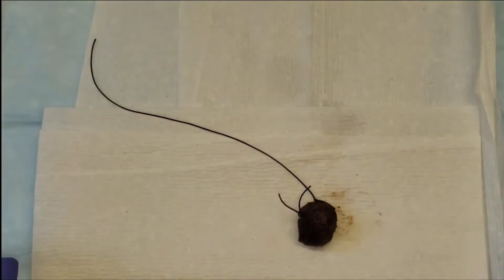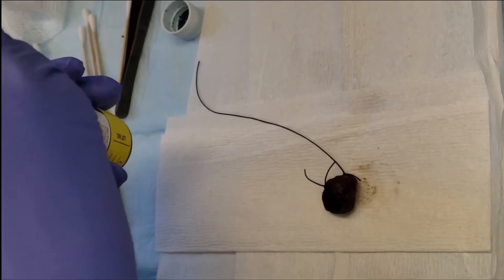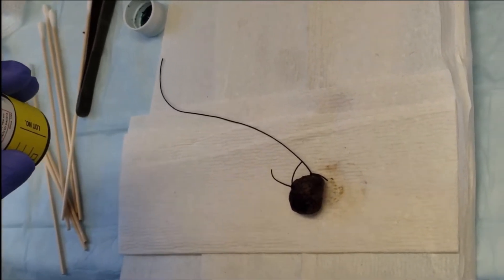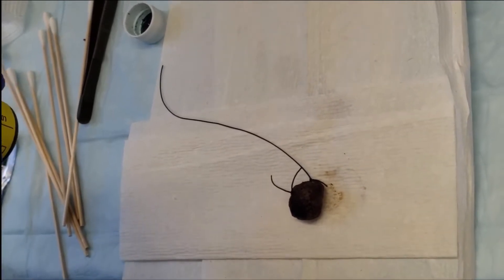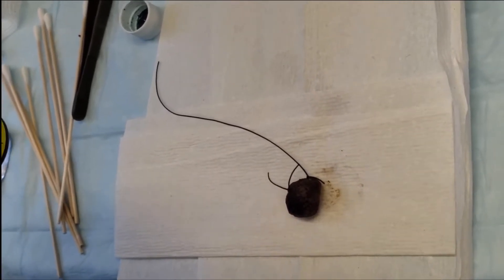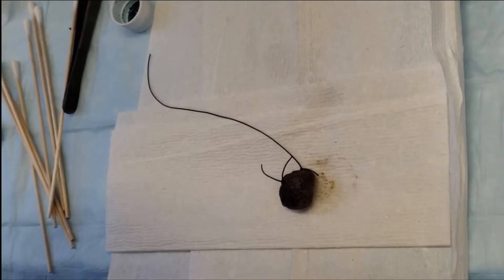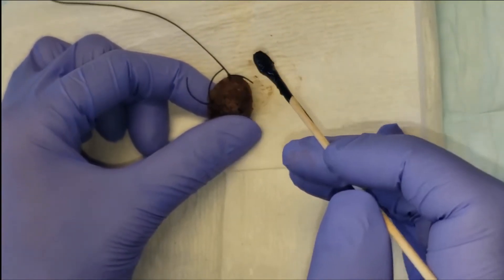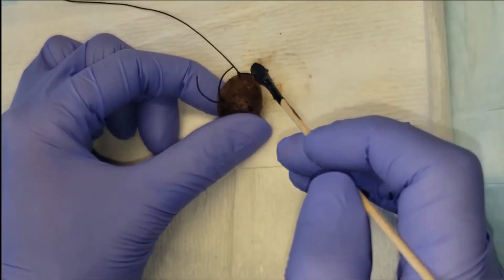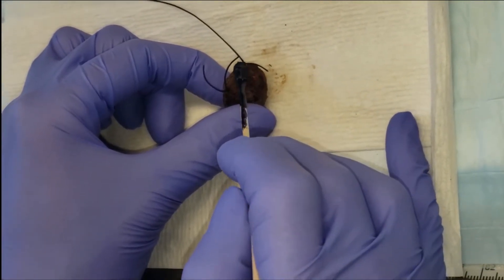You can appreciate that the surgeon has left in some sutures for us, and that's to give us a guide. We know that the long suture is anterior and the short suture is superior — thanks to the surgeon leaving them behind to give us a map. We can't process those with the specimen and we need to know what side the tissue is from.